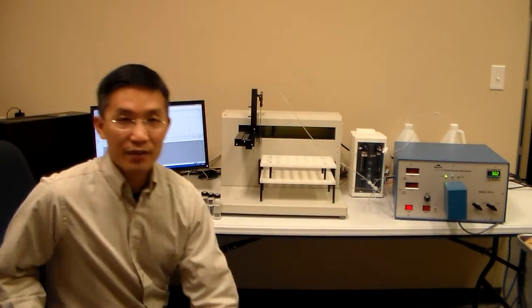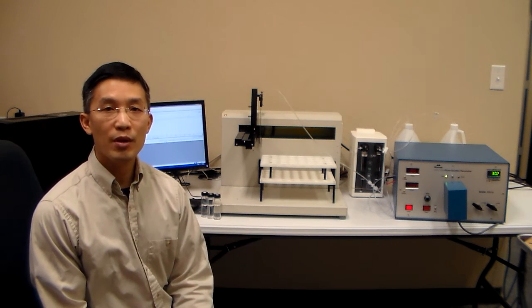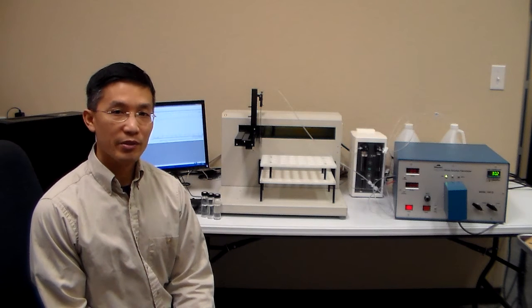Hello, my name is Matt from Houston MJ Associates, and this demonstration video shows how a Y501 with the Autosampler package runs a sample sequence.